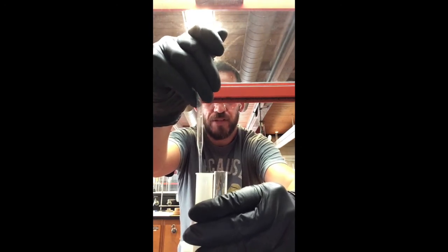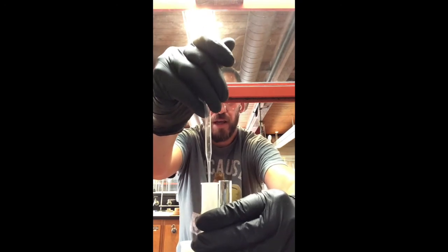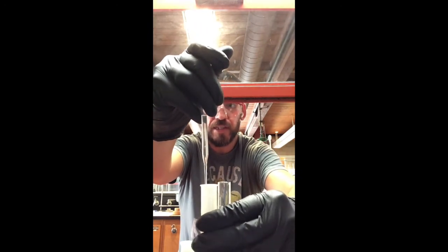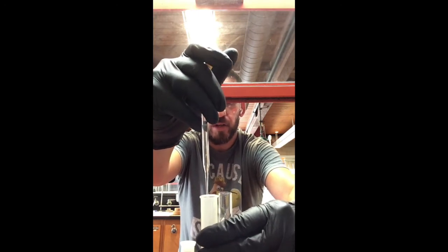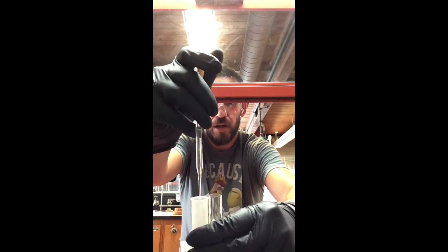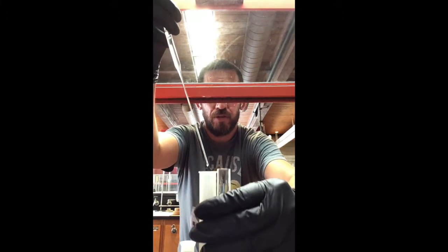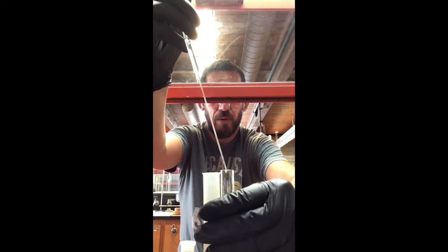I don't want to create too much of a disturbance, which is why I'm doing it like this. If I go in there and then squeeze it, all the bubbles might mess things up for me. And so now I'm slowly releasing the bulb on the top, because I don't want to take necessarily all the methylene chloride on the bottom, because I don't know if that's going to completely fill the pipette or what. And so now that we're done, drip, drip, drip. Now I'm transferring. Boom.